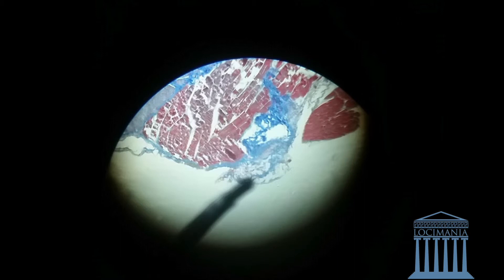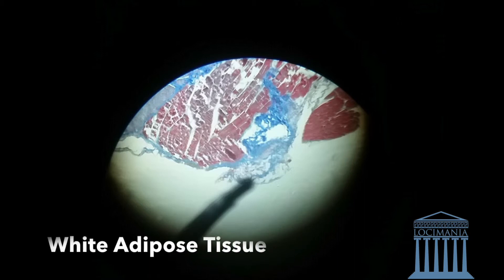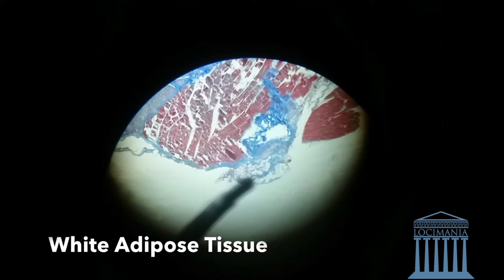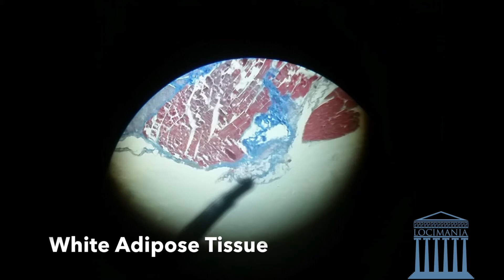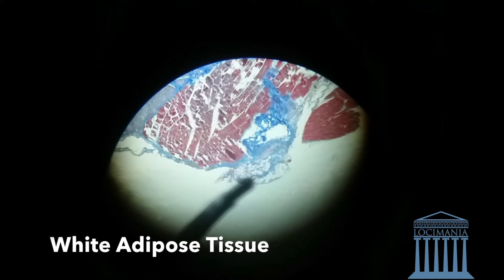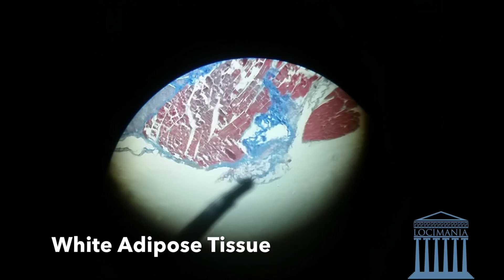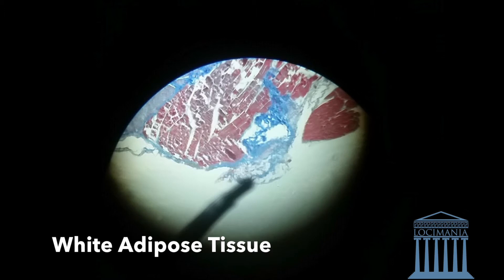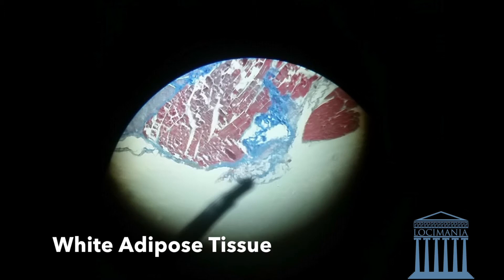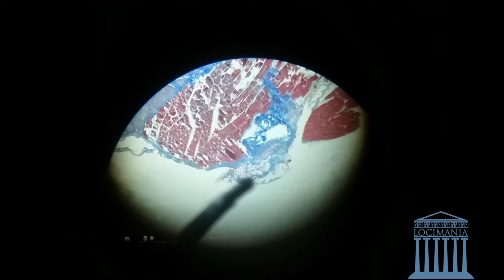Let's go on to the white adipose tissue. It's round and hollow, and it has its nucleus on the cell wall — one nucleus. If you see something that is round and hollow, it's white adipose tissue, as we can see here.